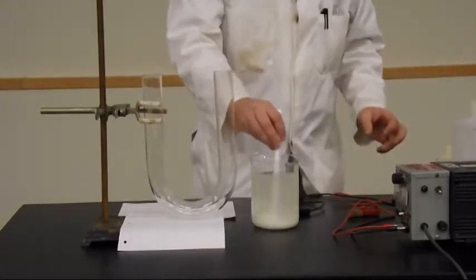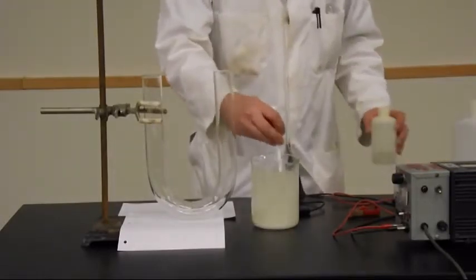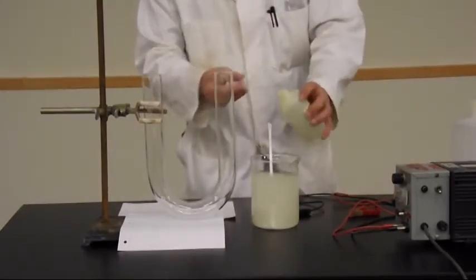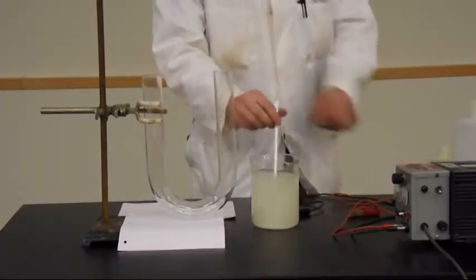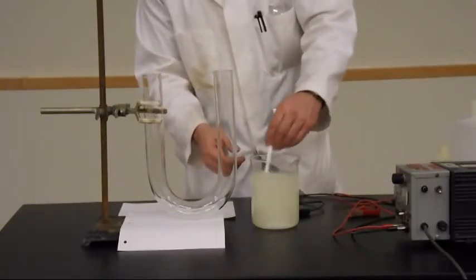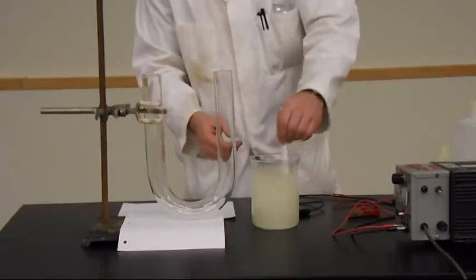So I'm just making up effectively a two mole per liter potassium iodide solution. I'm going to add a little bit of phenolphthalein indicator. This isn't like a titration so I don't need to be precise in how much I add. And we're going to let that dissolve.